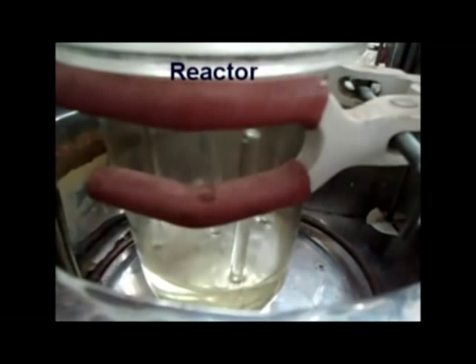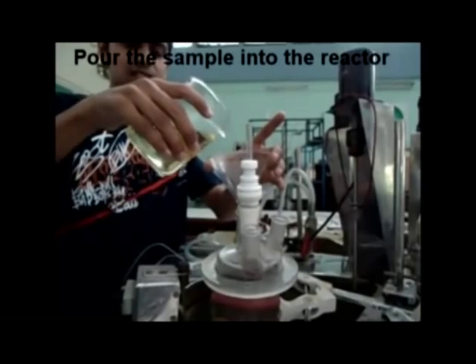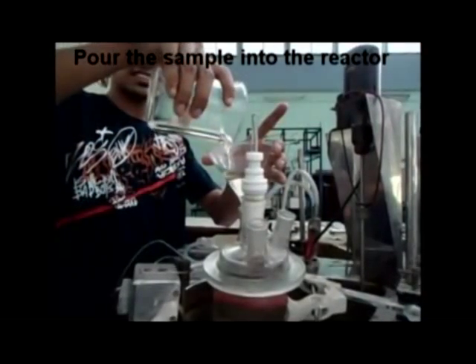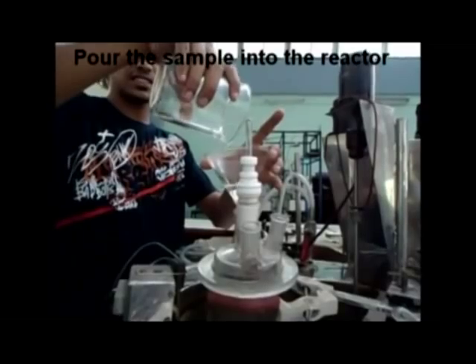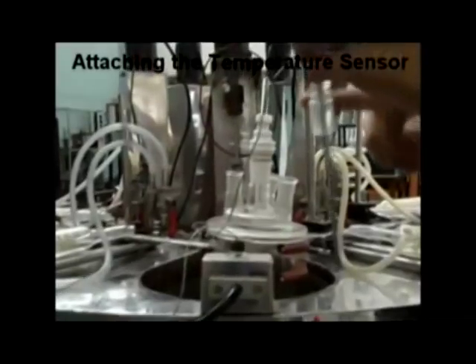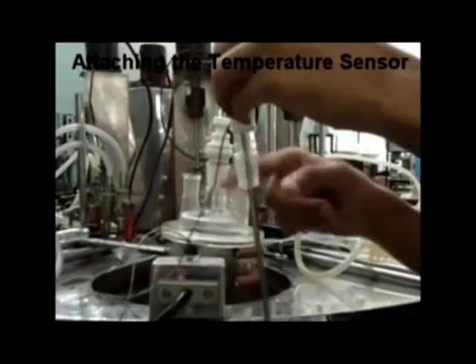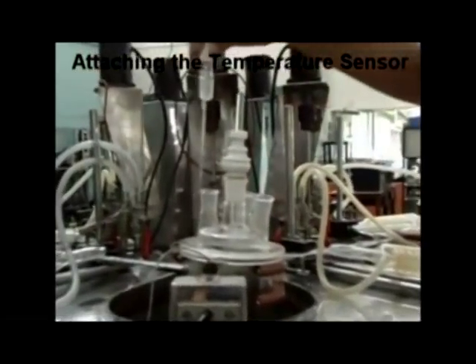This is our reactor. Pour the sample into the reactor through a funnel, making sure to lift the funnel a little above the mouth of the reactor. Apply grease to the temperature sensor and close the mouth of the reactor.